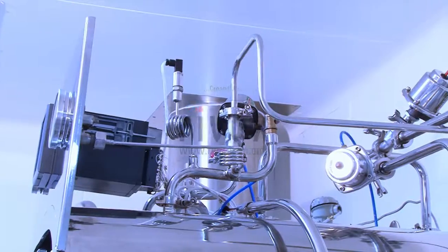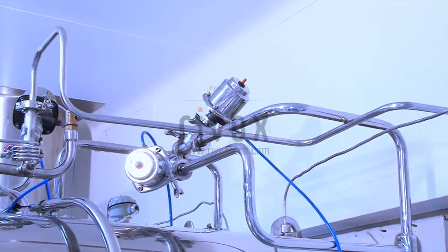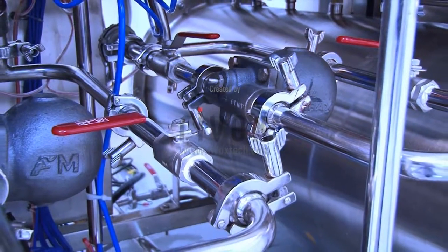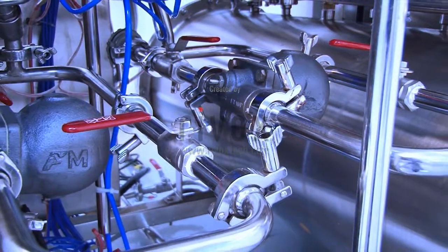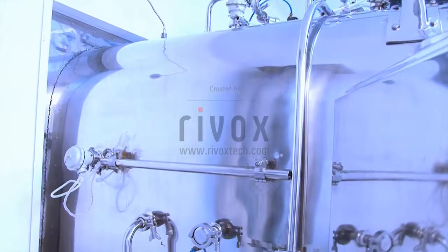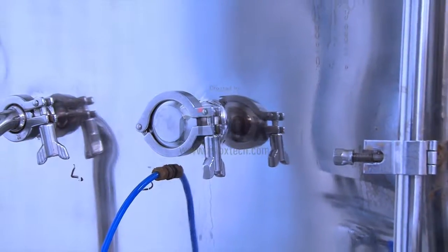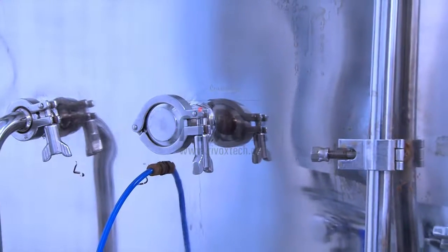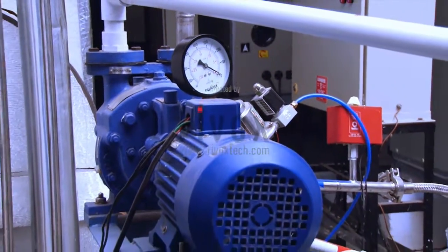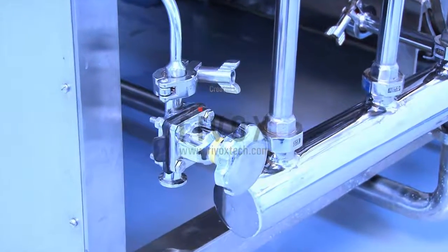A contamination seal is provided to prevent cross flow of air between the clean and unclean areas. All process pipelines are orbital welded and provided with tri-clover and float-type steam trap assembly to remove plant steam condensation.